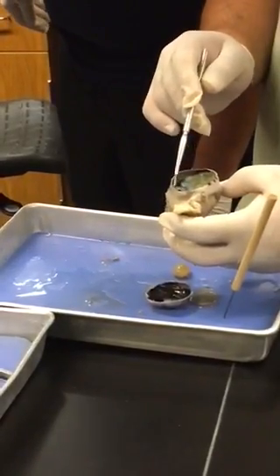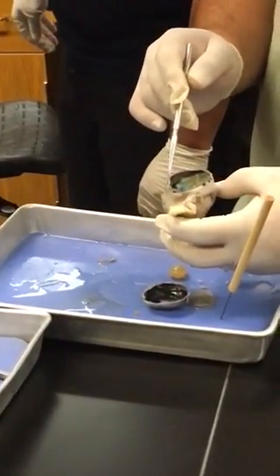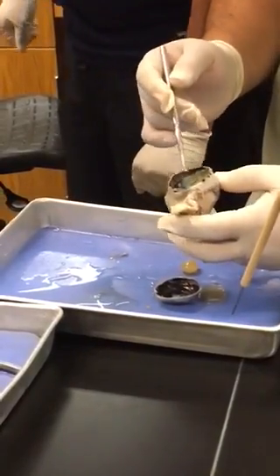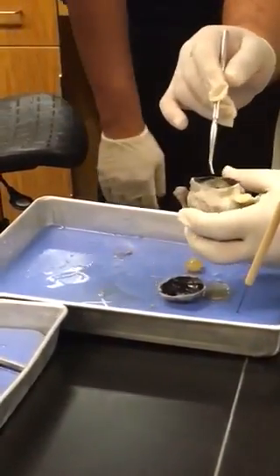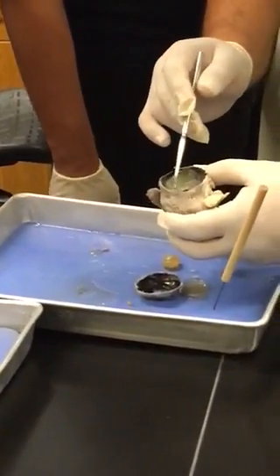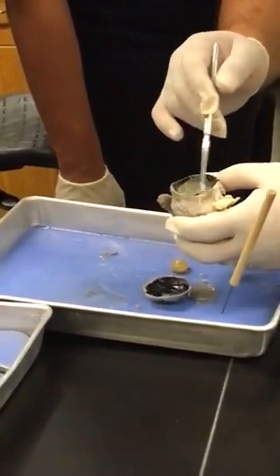This whole structure would be what? What do we say the neural tunic basically was? Oh, the retina. Right, so the beige thin membrane that you're seeing, that's the retina. And that's also going to be your neural tunic, right? Because this is where you find your sensory cells.